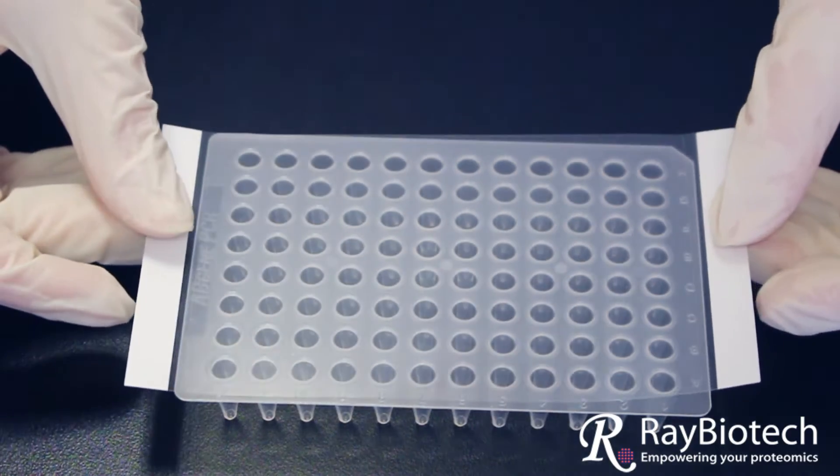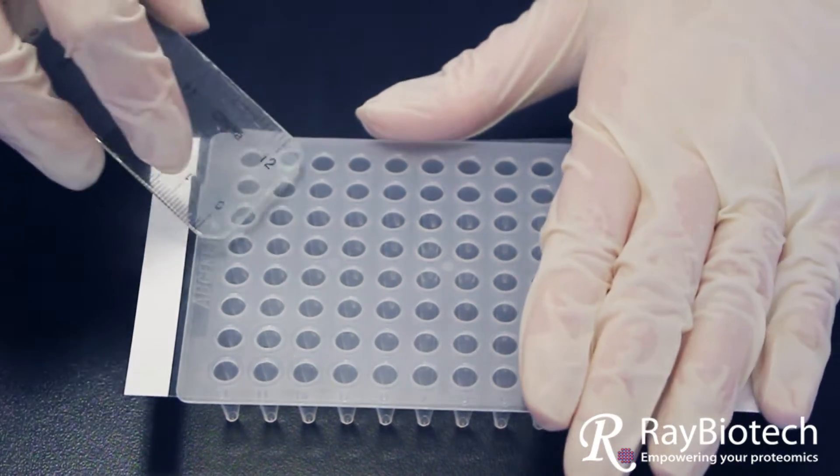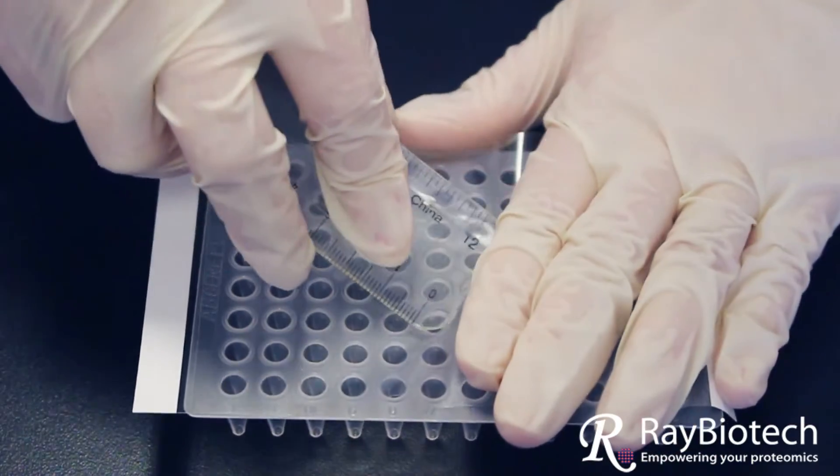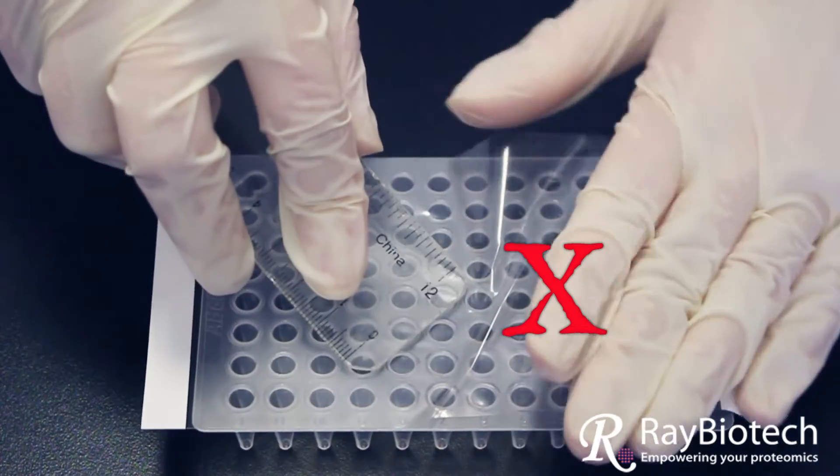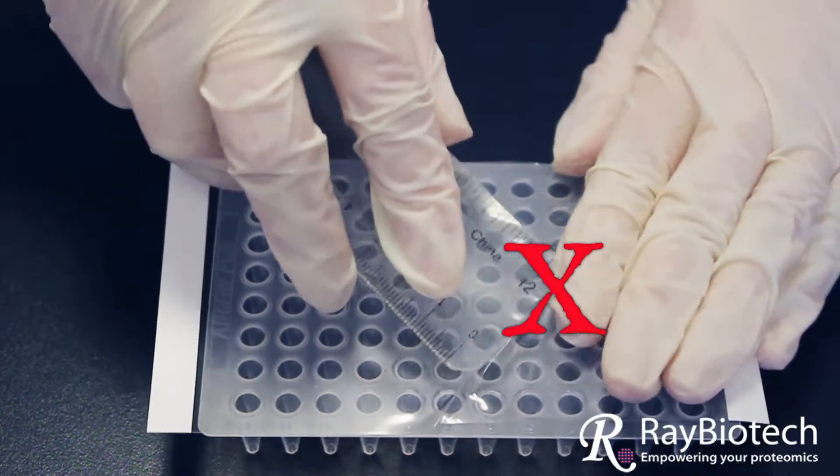If improperly sealed, that force will lift up the plate film making it so that evaporation can occur and compromise your fluorescence readings. Each reaction should be maintained in a closed system contained within each well.